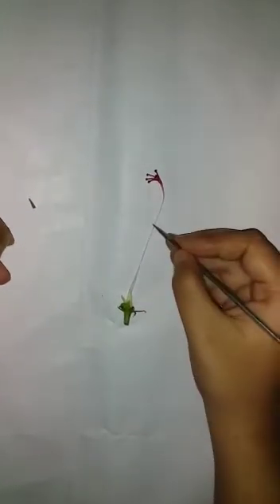This is the gynoecium, having the ovary, style, and stigma. Look here — there are 5 stigmas. Now make a transverse section through the ovary to see the placentation.